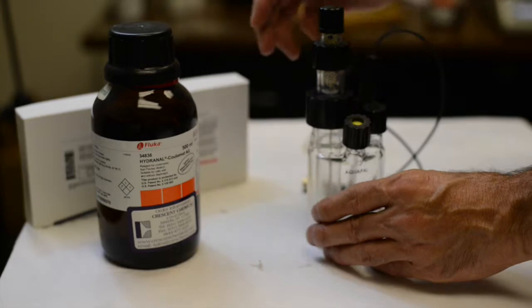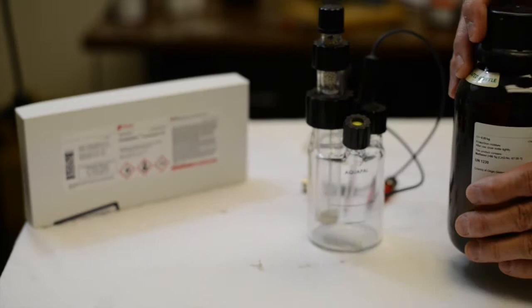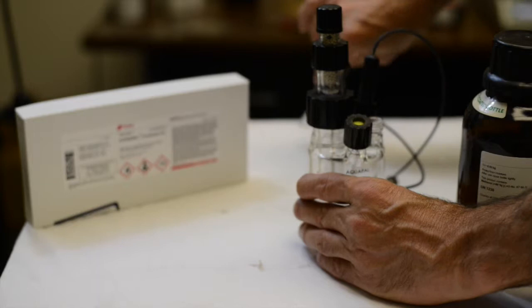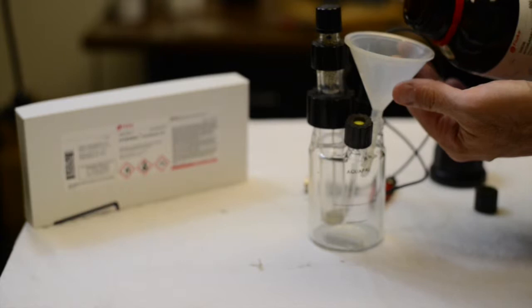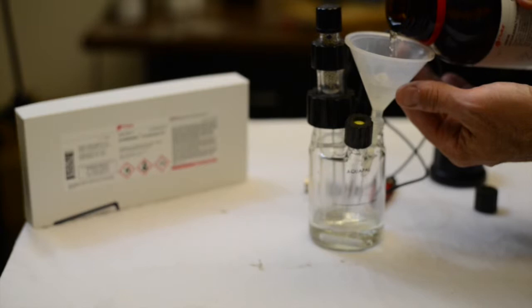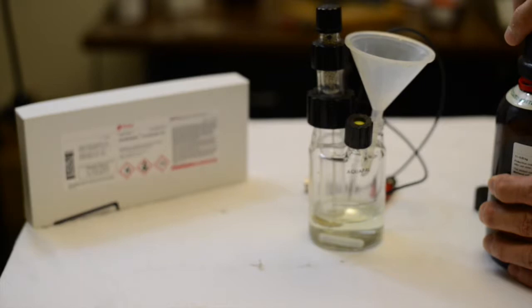Watch now as we introduce analyte into the vessel. Let's fill and drain the vessel. Open the vessel.